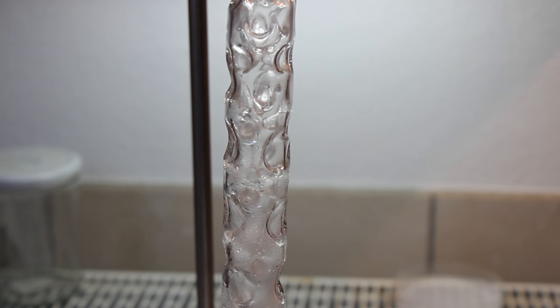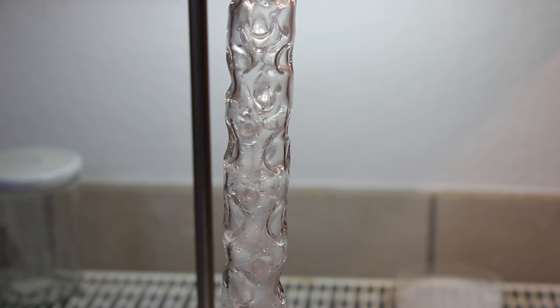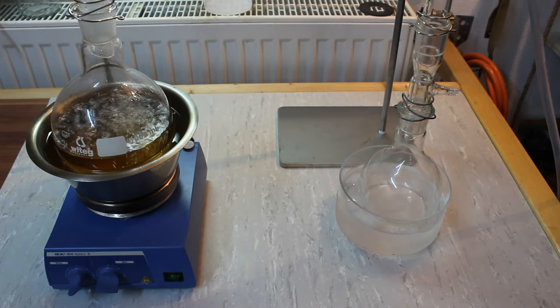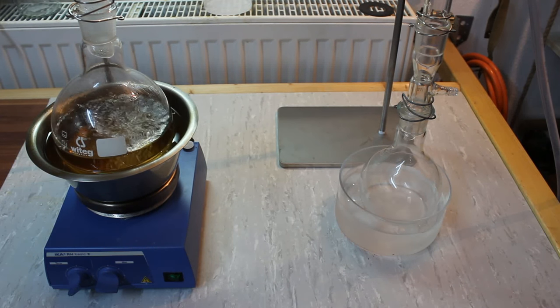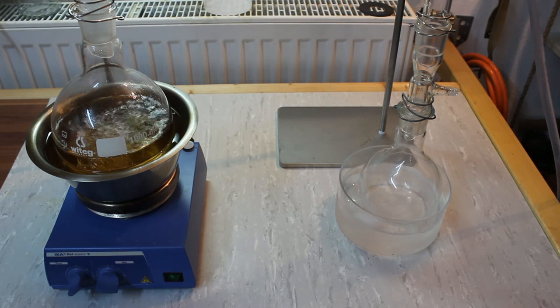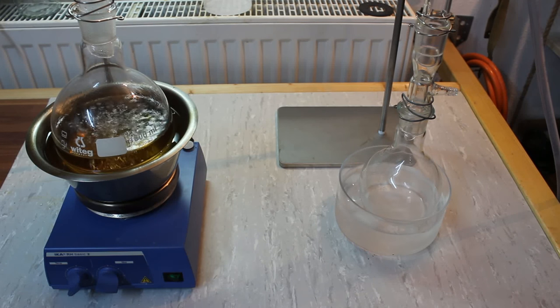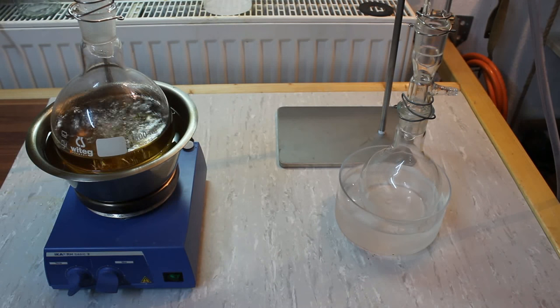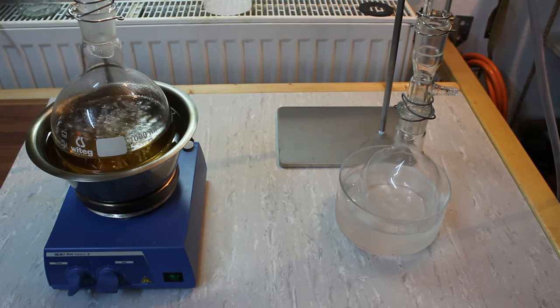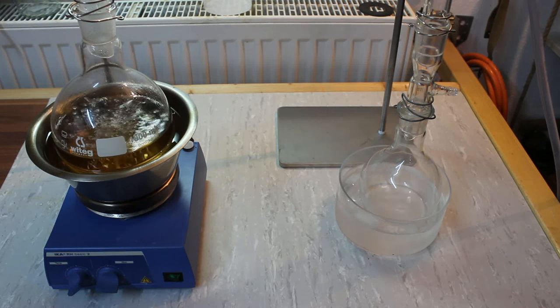You can see vapors are slowly starting to rise in the Vigreux column, which indicates we will soon start collecting product. The reaction has now really started and we collect product at a pretty fast rate. It's pretty easy to overheat the whole thing because the reaction needs quite a bit of heat to get started, but once it does it's very easy to overshoot your column and ruin your yield. So just be gentle, be patient, heat it up very slowly, and once it reaches a nice constant boil leave it at that temperature.